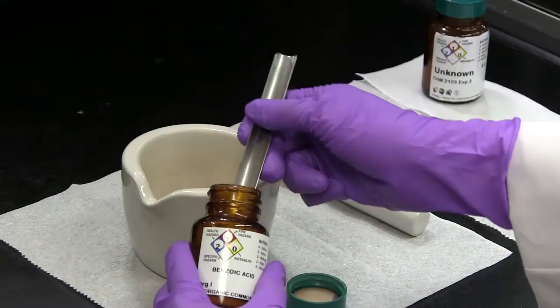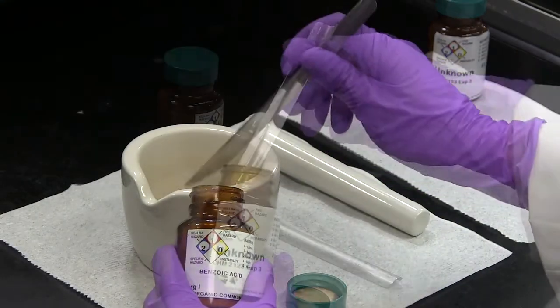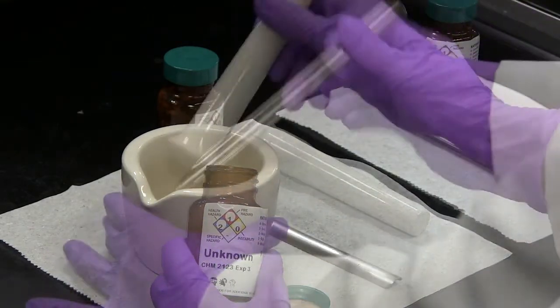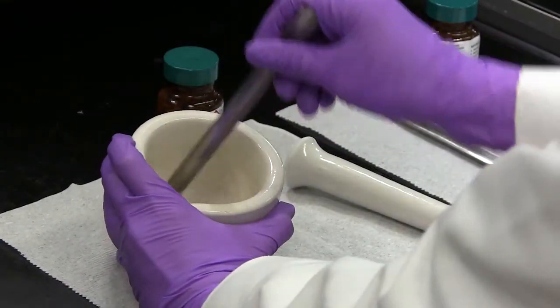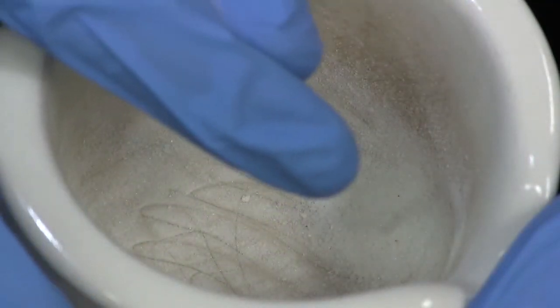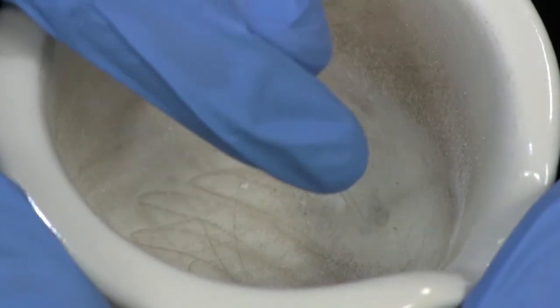Now add equal amounts of benzoic acid and the unknown to a mortar. Grind and fluff the mixture as before. Pack the mixture into a capillary tube as before.